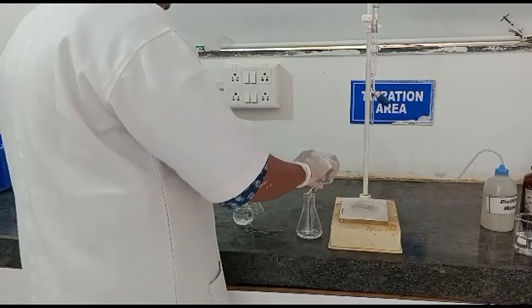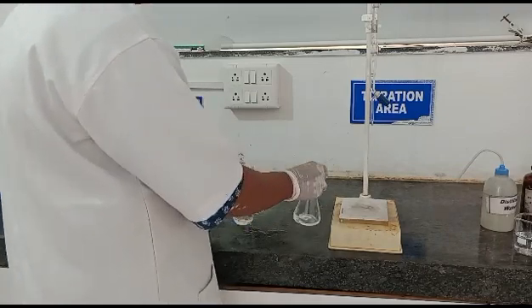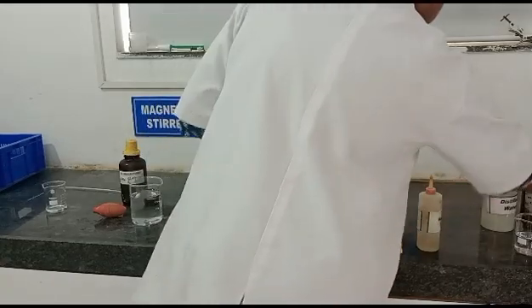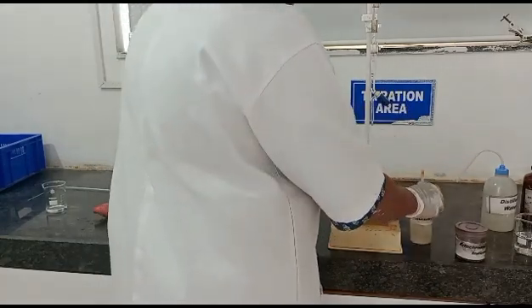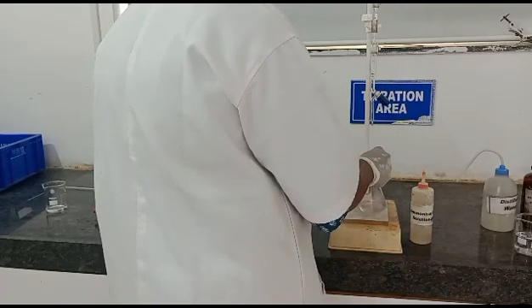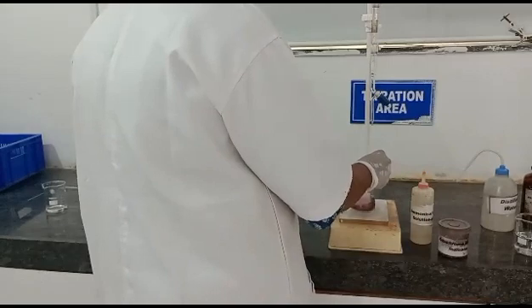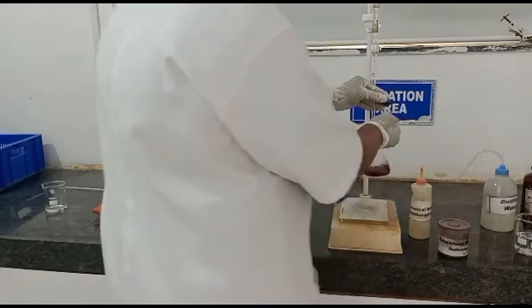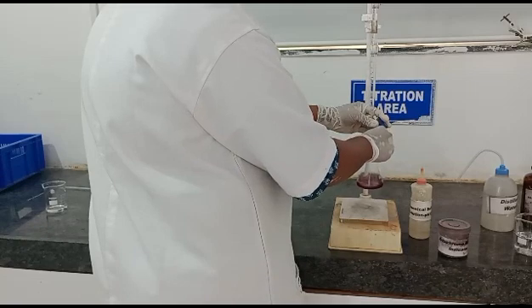Now transfer this volume into a clean conical flask, then add ammonia buffer pH 10 — sufficient ammonia buffer must be added until the pH becomes 10 — and then add the Eriochrome Black T indicator. Now titrate it against 0.01 molar EDTA, of which we are going to determine the standardization. Titrate drop by drop till the end point, which is a pure blue color.